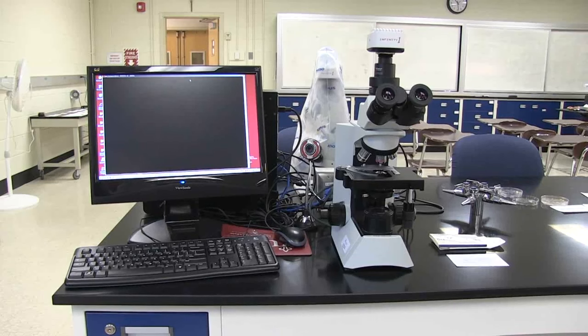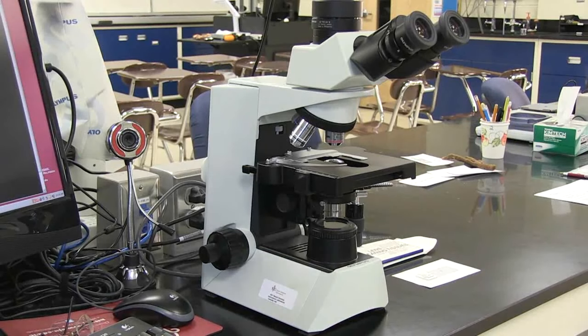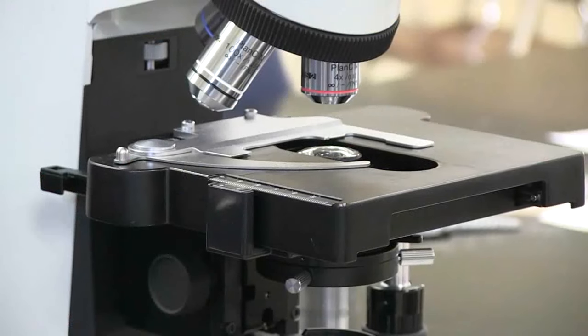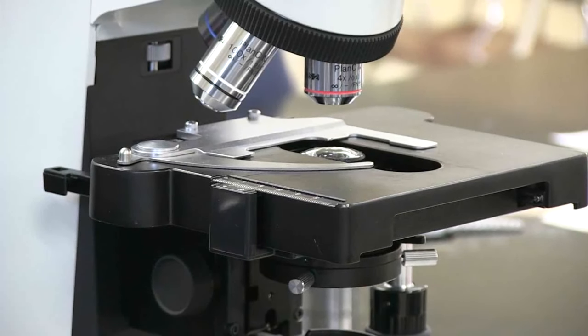In this video, you will learn how to use the microscope. Microscopes are used by scientists to allow them to see things smaller than the human eye can detect.